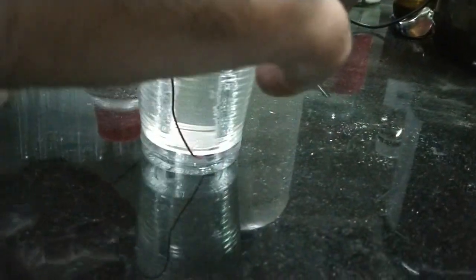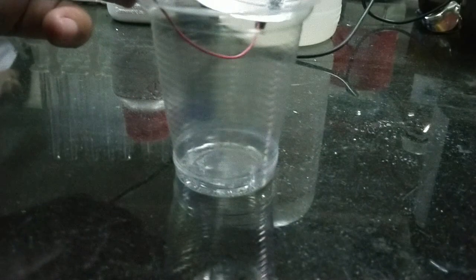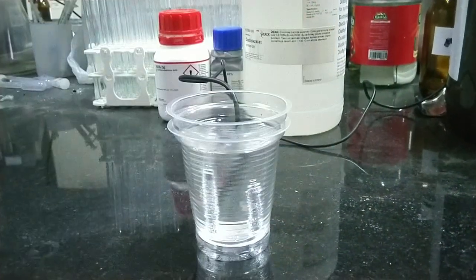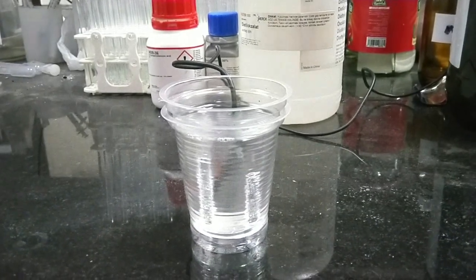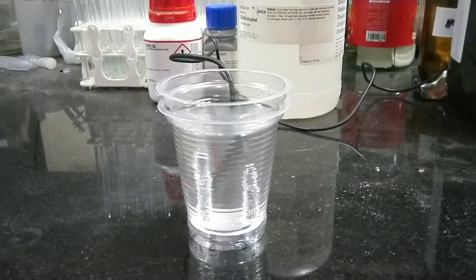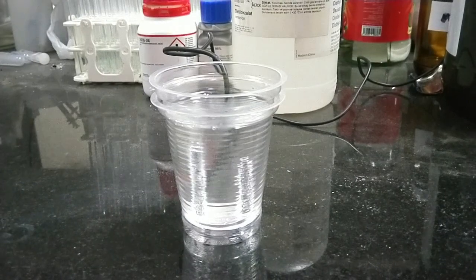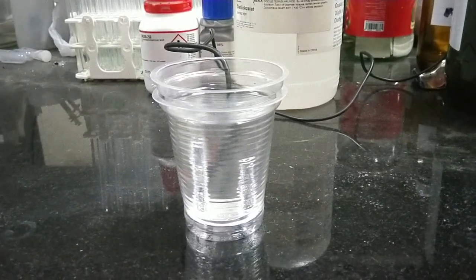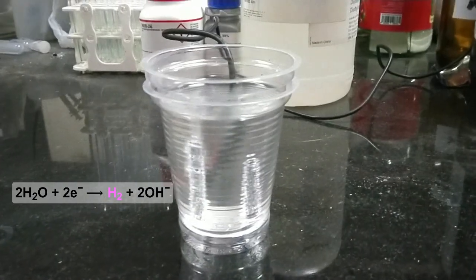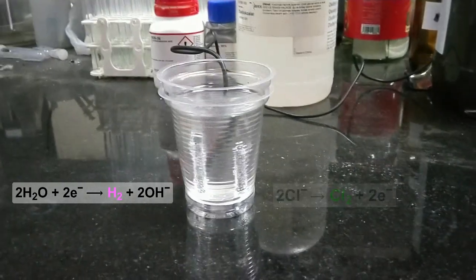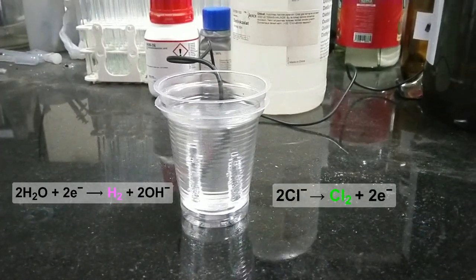Now as you see the electrolyte is running, and the electrolyte is this sodium chloride solution. So on the cathode you have the hydrogen gas bubbling out of the system, and at the anode you have the chlorine gas bubbling out of the system.